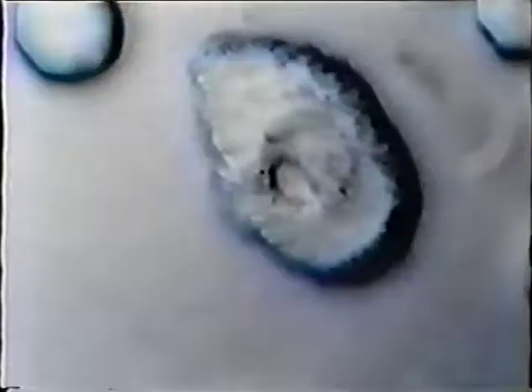This is a white blood cell, has some curious anomalies. What I'm doing right now is I'm using inverse video, which gives a 3D-like effect, and you can get a concept of what the surface of the cell looks like. You see from this video, it looks like this fellow has a hole punched in him there or something. Not a very healthy white blood cell.